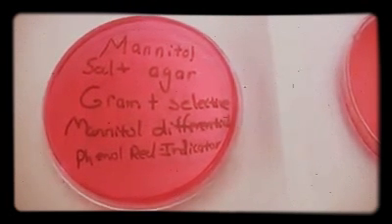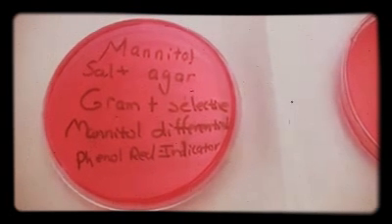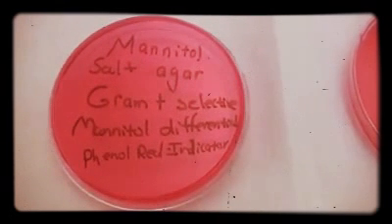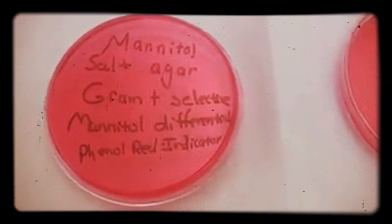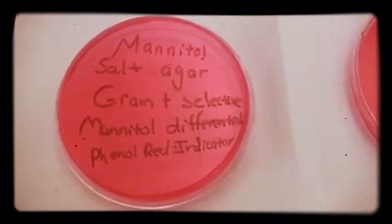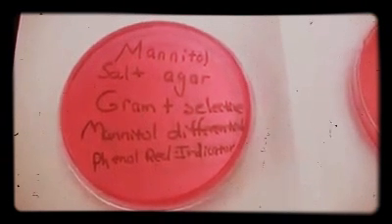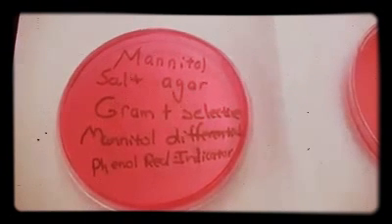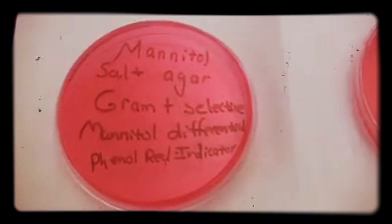Now, some other gram-positives are actually salt-sensitive, such as the Streptococcus organisms, so they actually will not grow on this plate. So it's selective for some gram-positive organisms. There are some halotolerant gram-negative organisms out there, but we don't use them in this particular course. So we just simply say that the MSA plate works well to select for gram-positive organisms that are halotolerant.